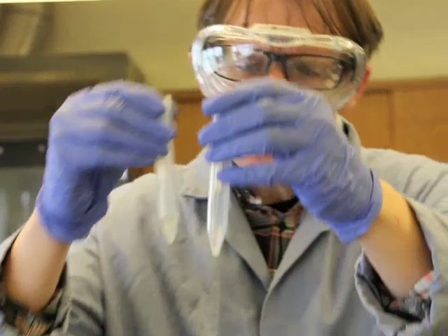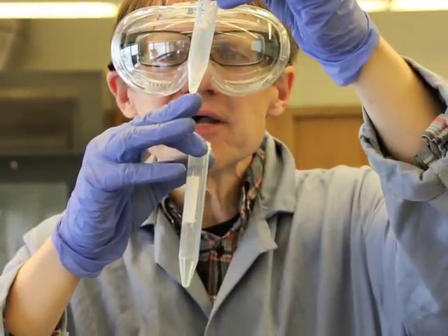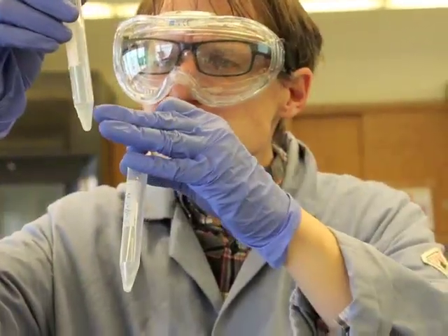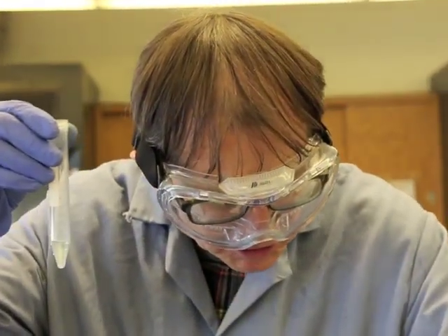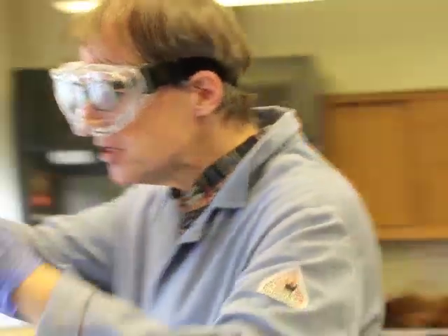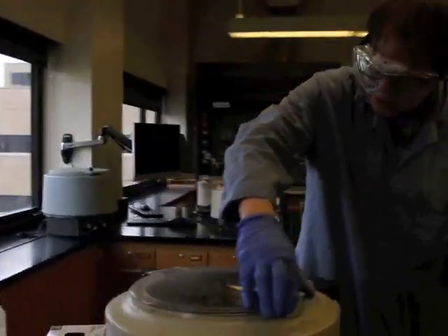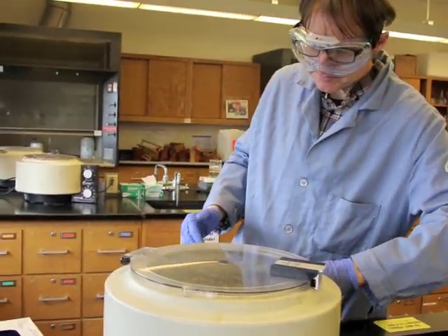We could pour the whole thing back in there and recentrifuge it, or we could say, wait a minute, we still have a lot of the solid in here, so that looks pretty good, but maybe we'll just want to clean up the supernatant here and precipitate out the solid there. So we'll try it that way. So I'm going to take this, put it back into here, close the lid, and we'll centrifuge this for a couple minutes just to clean that up.